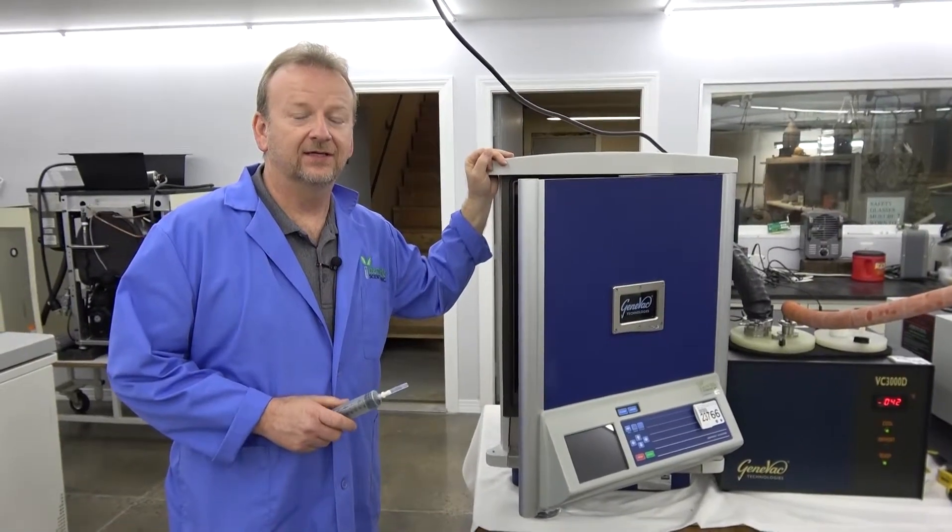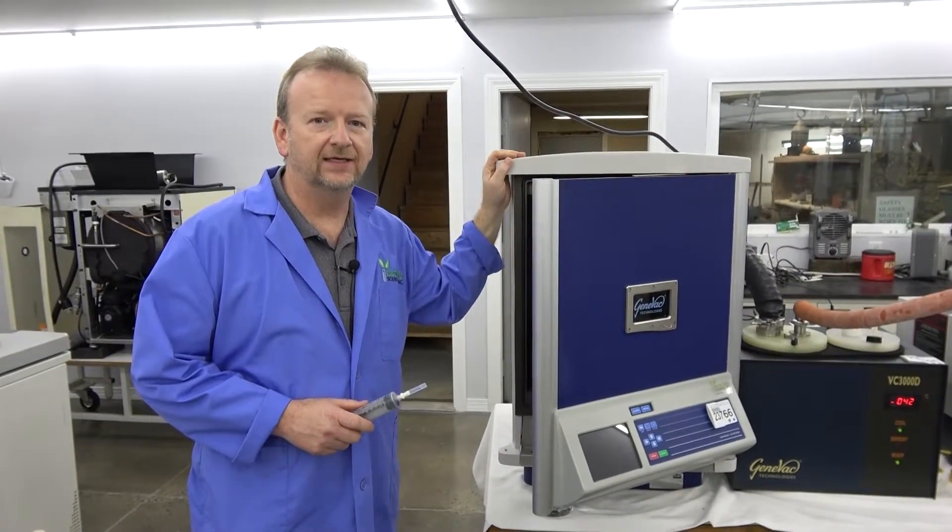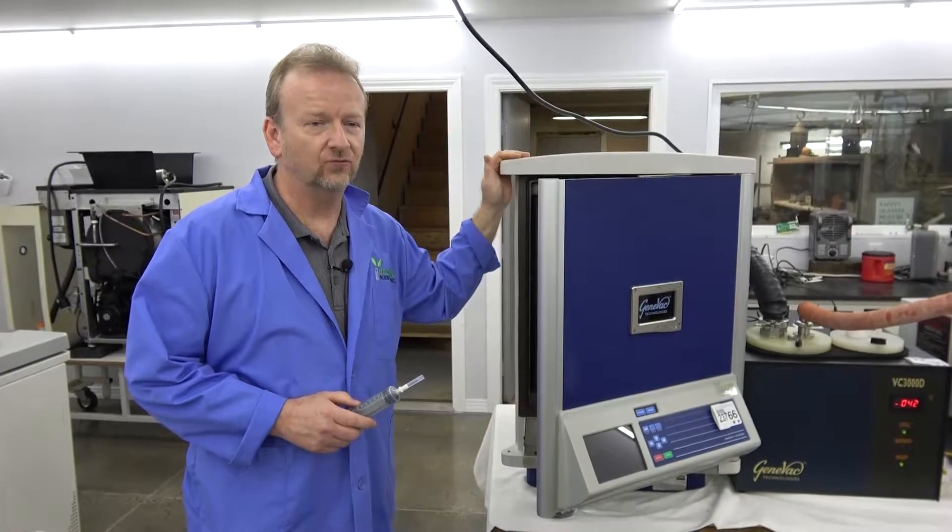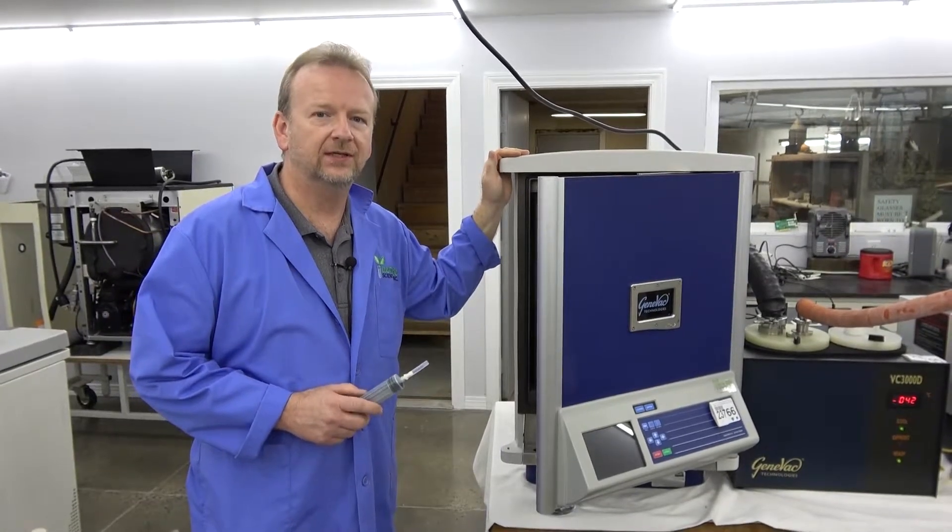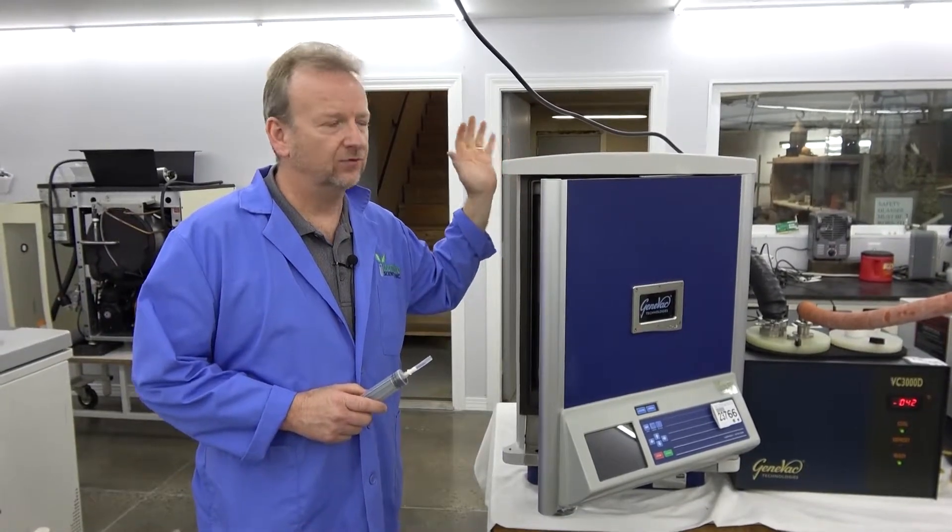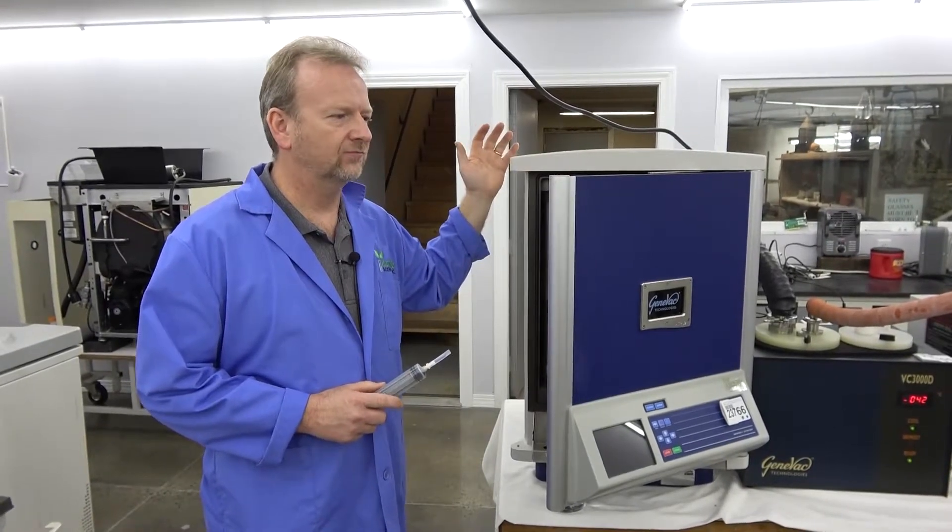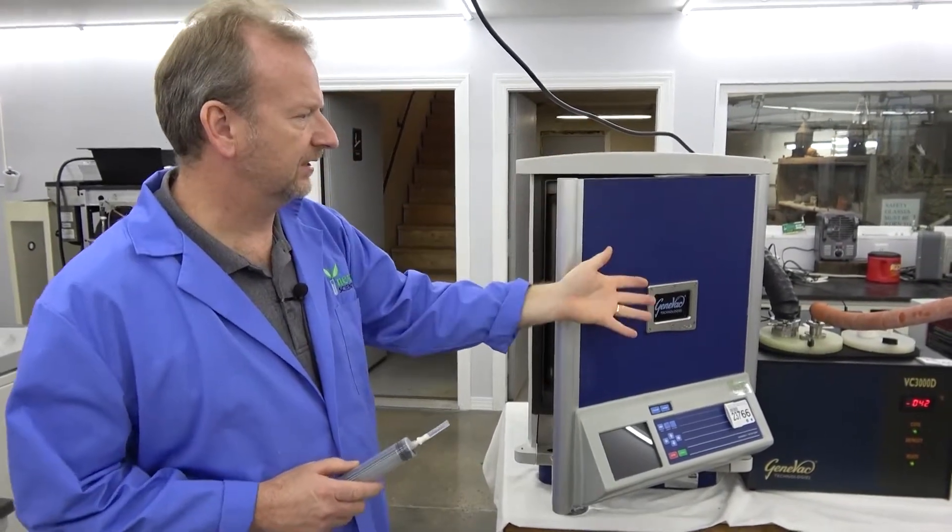Okay, I'm Rich at New Life Scientific. We went ahead and pulled the Gene Vac down, and I know you wanted to see it run for the last time before we shipped it, so I've gone ahead and set it all up, and we've got all the temperatures all ready to go.